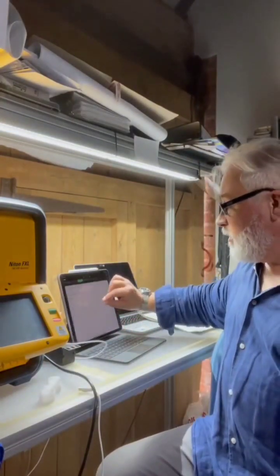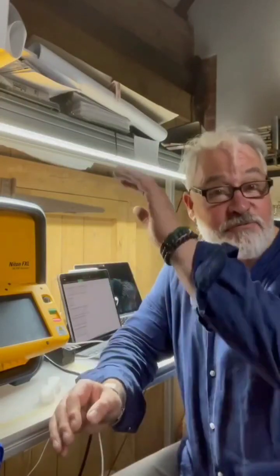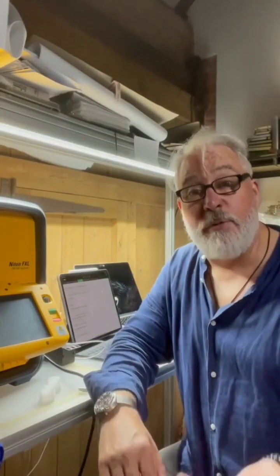So what's my conclusion? My conclusion is that it's a little bit misleading what they said in the mainstream media. You definitely can't say this was Sahara sand. However, it's very much in the same baseline, and I would say it's very close to a fingerprint of what we know as atmospheric dust from a region which has a large body of sand dunes. So atmospheric dust, pretty much the same all over the world. I've taken baseline data that is really direct from source. So these are really high elevated numbers, yet what we have here in the UK, we've got certain elements that are much higher than I would expect to see. But it does follow that this was an atmospheric dust.